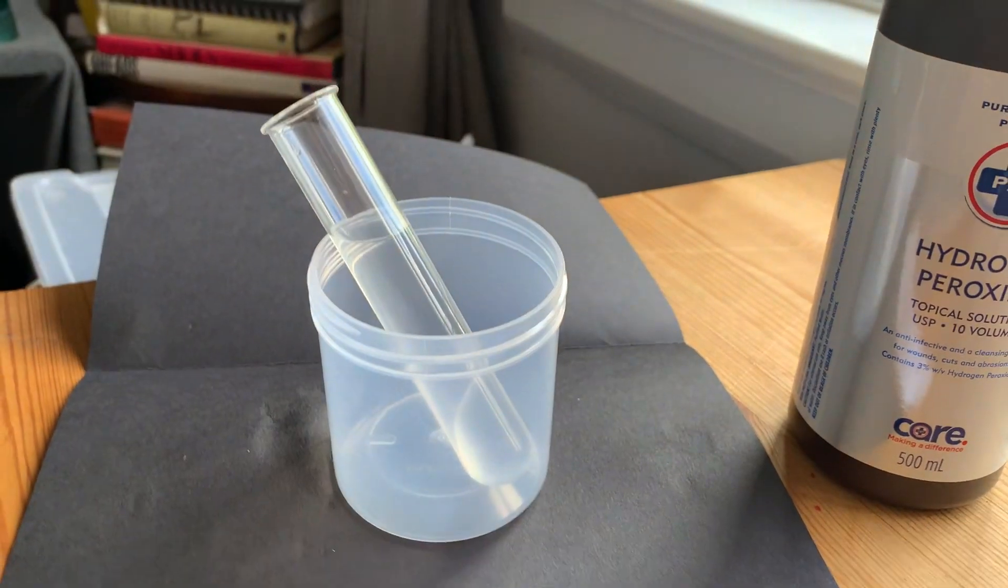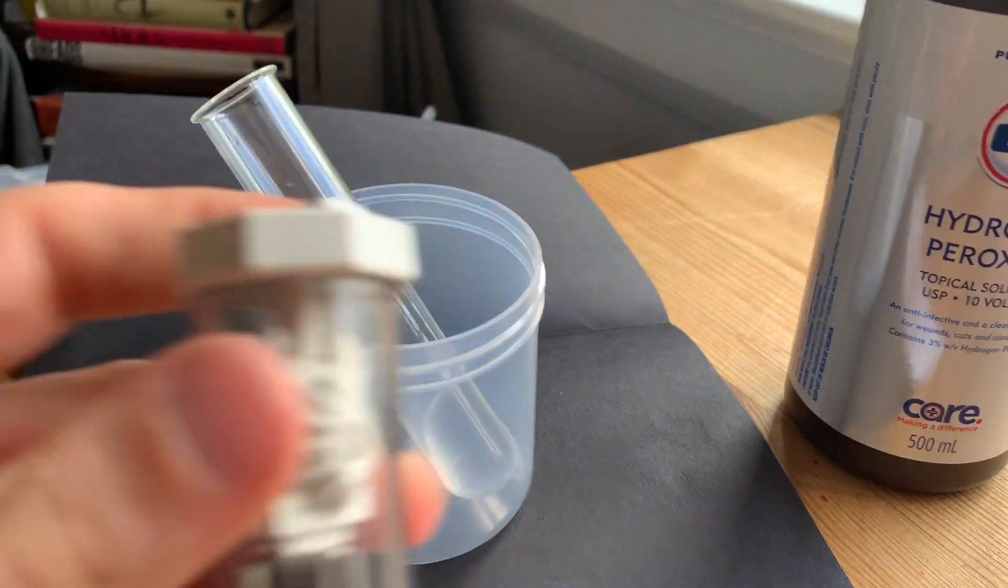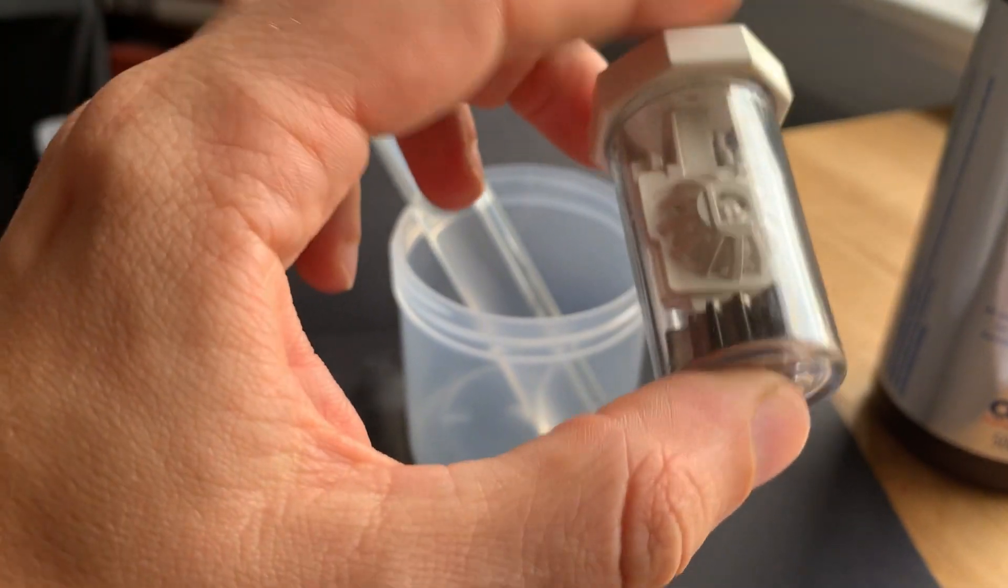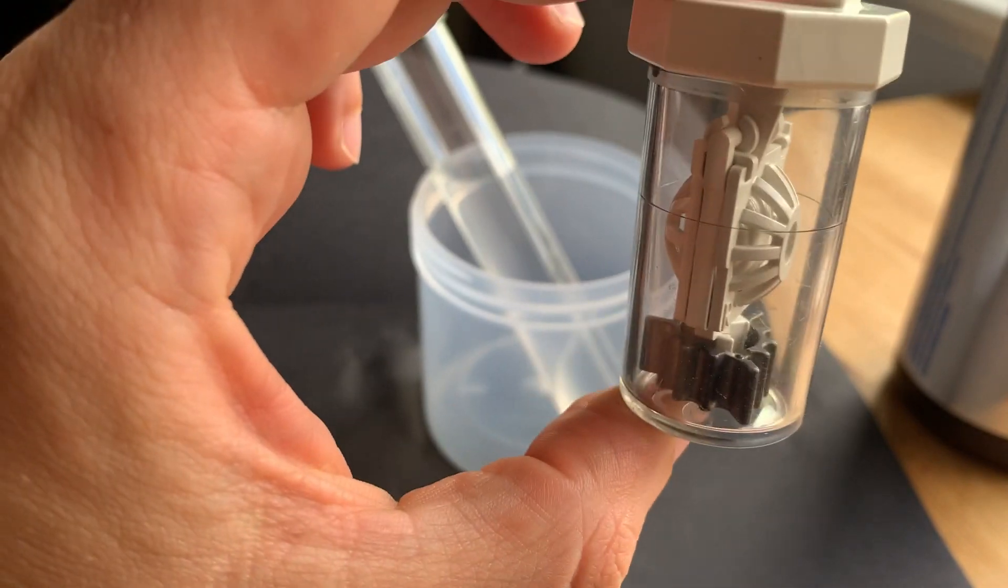Both of those ways involve using catalysts. I have here one of those things that you put contact lenses into when you're trying to clean the oils off of your contact lenses. I don't wear contacts, but I know someone who does.